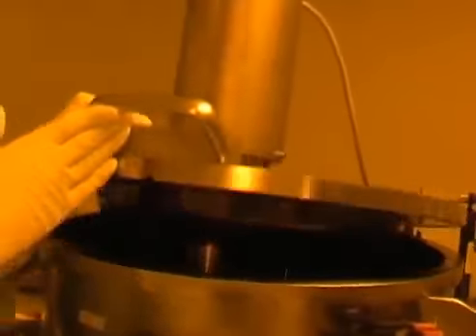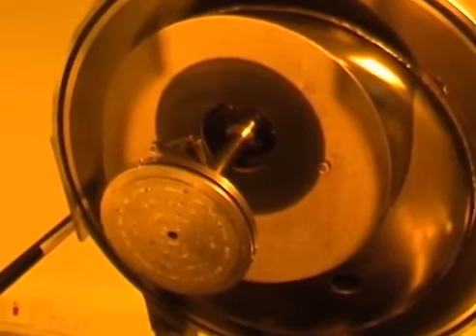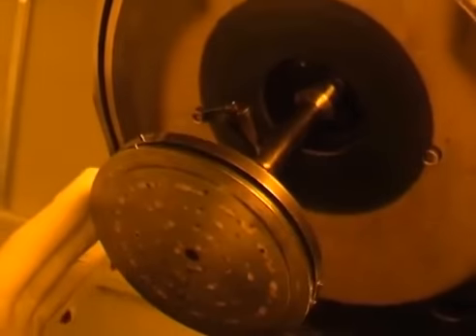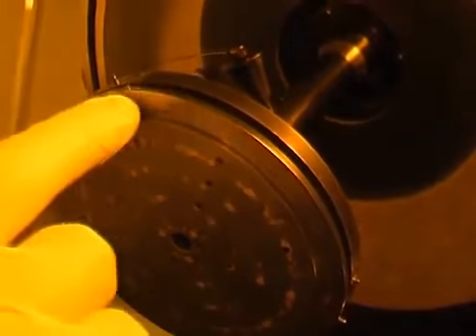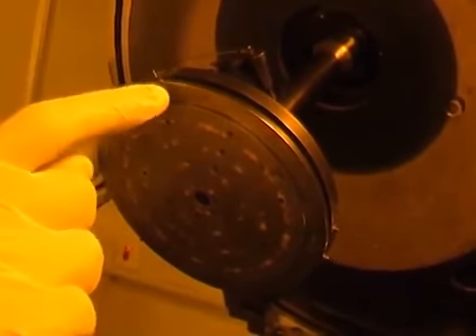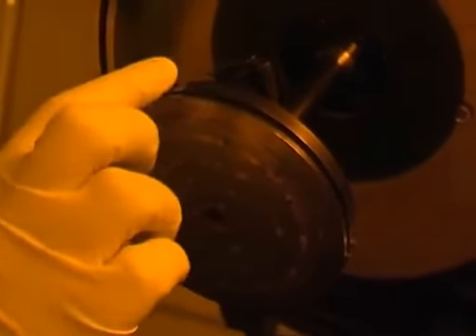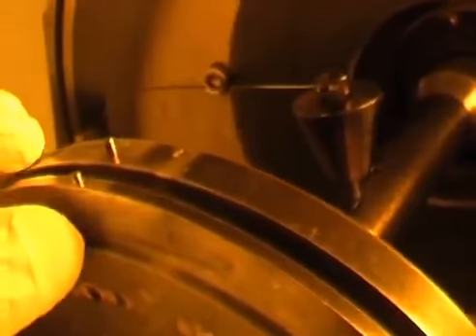Let's open the chamber and see where we are going to place the wafer holder. One important thing to make sure before we put the wafer holder in is that these two discs that one can see here have their notches aligned between the two of them. In case they are not, I make sure to put them aligned like these, like you can see here.